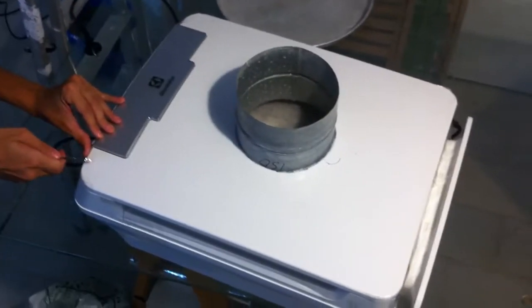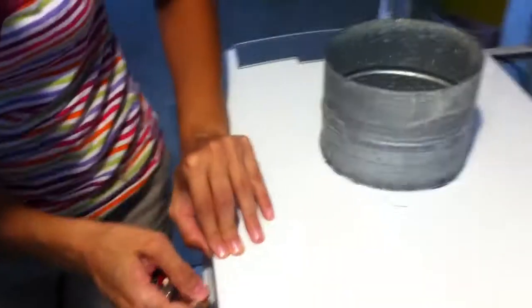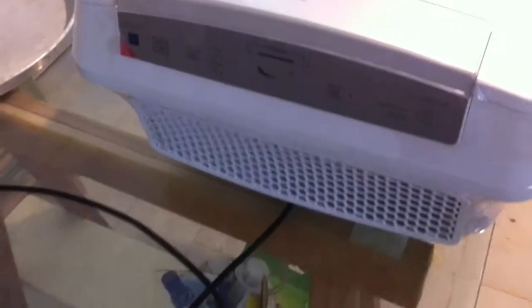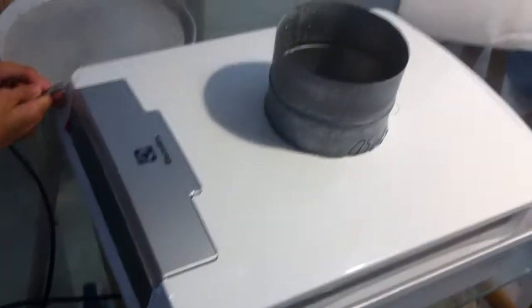Today I would like to show you the air cleaner that we fitted with the pipe to be able to connect here. We also made some small modifications — it was open all around and I closed it with tape, as you can see. Now Lina is cutting the tape all around to open it. It's a HEPA air cleaner, and we can connect it like this so it pulls air from outside and pushes only HEPA-clean air inside the room.